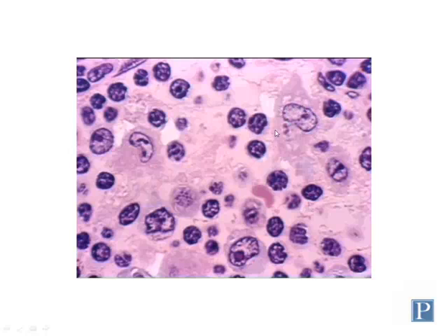The actual cytoplasmic boundaries of macrophages, because of their irregular shape, can somewhat be difficult to differentiate from the background tissue, but you can see the borders of this macrophage here extends out quite a bit from the nucleus. Here's another macrophage, and it looks like their cytoplasm is fused a little bit, so it's a little bit difficult to see where one ends and another begins.